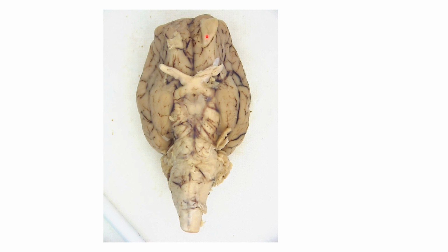For the nerves, we can see the olfactory nerve, and this part would be the olfactory bulb. This one right here is the optic nerve, and you can see that it's crisscrossing right there. The other nerves are pretty hard to see, and so we're just going to stick with, for the sheep, the olfactory nerve and the optic nerve. And you can see all of these dark lines, by the way, those are blood vessels residing in the crevices known as the sulci.